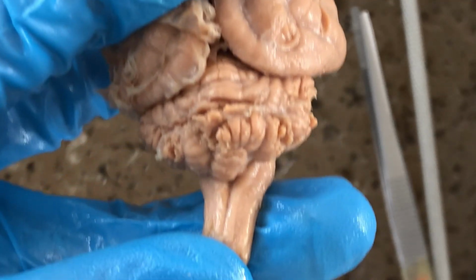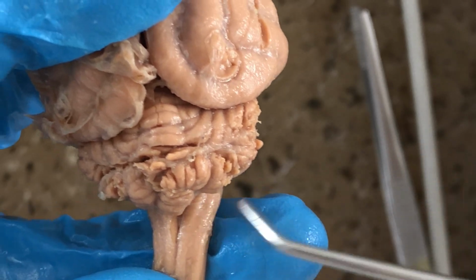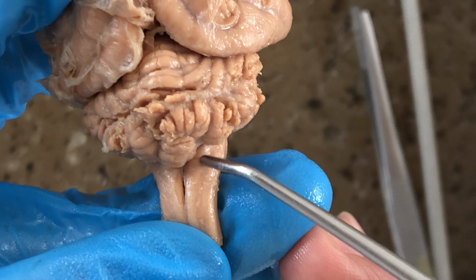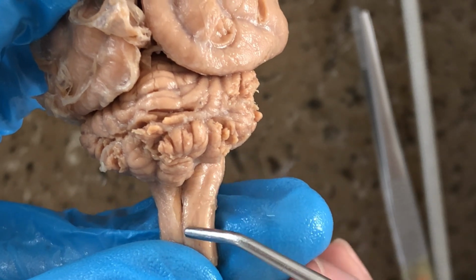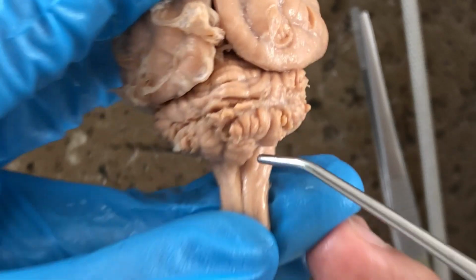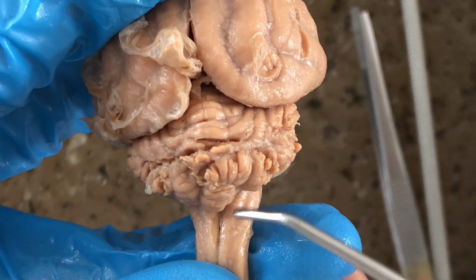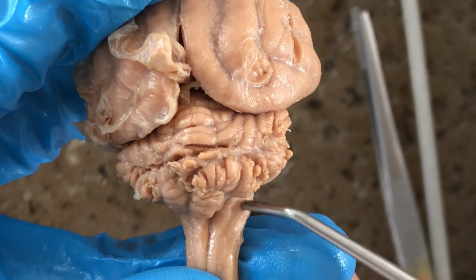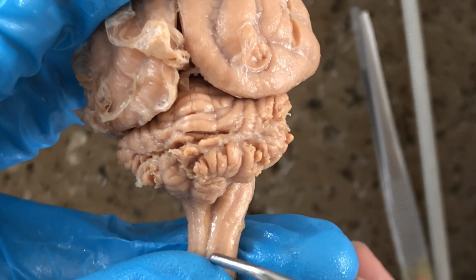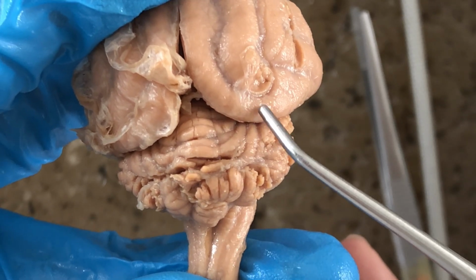So here's a close-up of the hindbrain. This region would be the medulla oblongata, and this one would be the cerebellum. And I just want to point out those longitudinal tracts you see in the medulla oblongata, dorsal portion. Those have names. Those are the somatic sensory columns of the medulla, containing axonal fibers, sensory fibers, relaying information from the body to the brain.